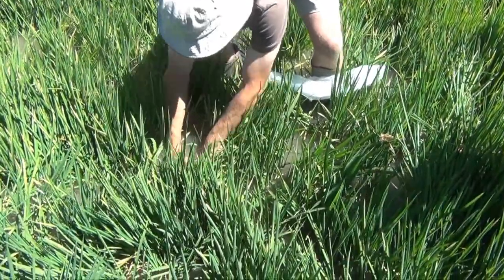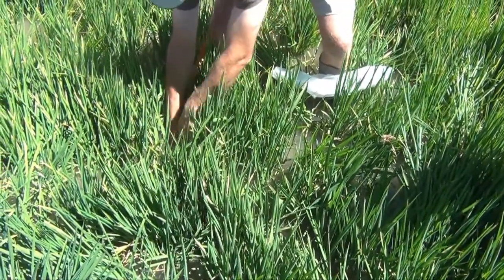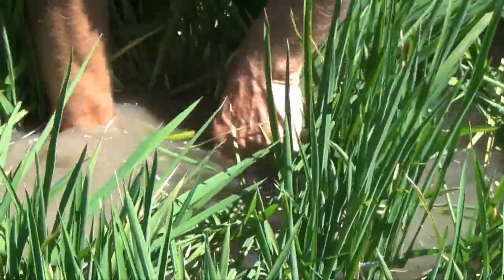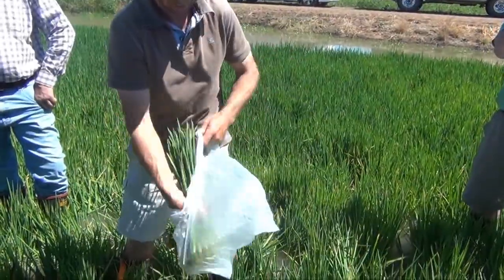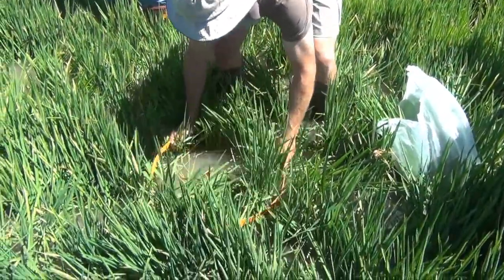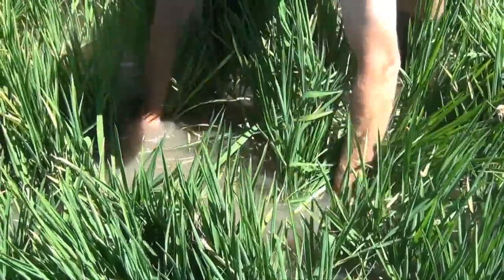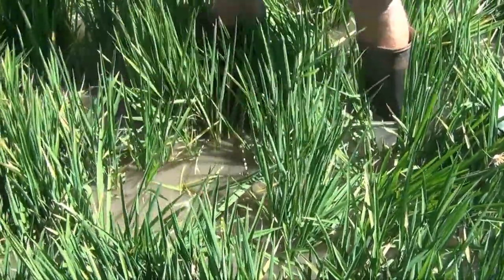Hold your wrist like that, make sure this hand is up so you're not going to cut it. Hold the plants above and cut a little area like that to start with. Give it a wash just to get rid of the slime, then put it in your bag. Once you've got a little bit out of the road, stick your quadrat down and use your fingers to go around at the base. You'll find the ring is right on the ground — just feel around and you'll have a definite in and out.